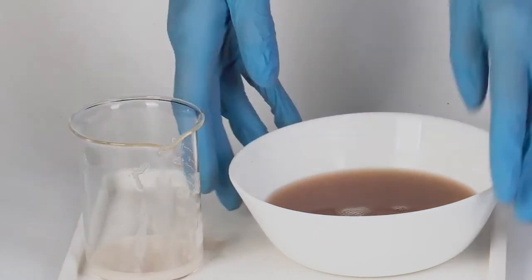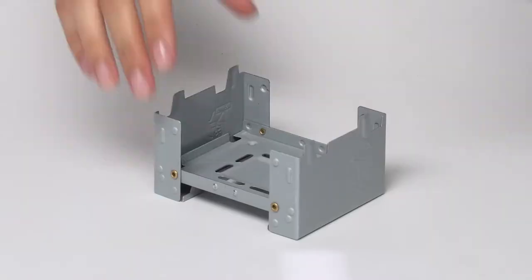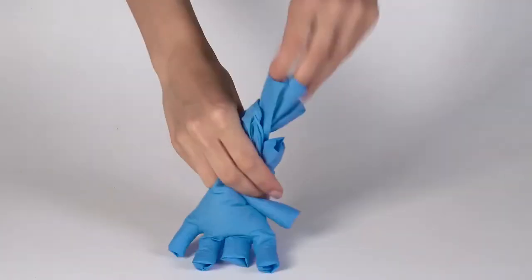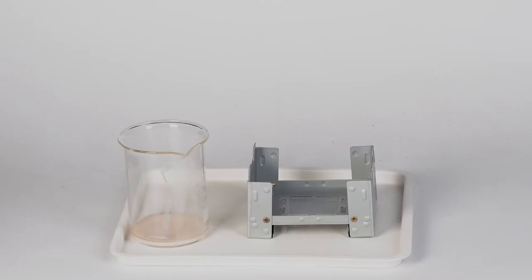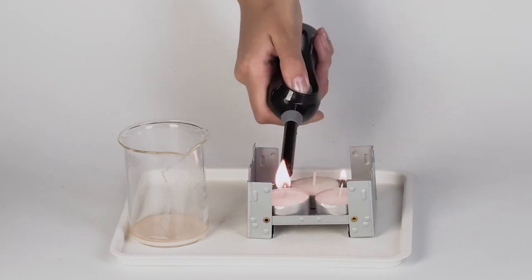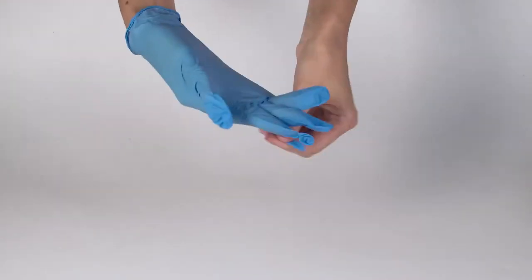Now heat the reaction mixture. First take the solid fuel stove and attach the thermosticker to it. Take off the protective gloves. Put three candles into the stove. Light them and cover the stove with the flame diffuser. Put on the protective gloves again.